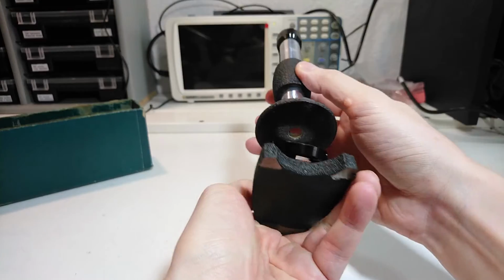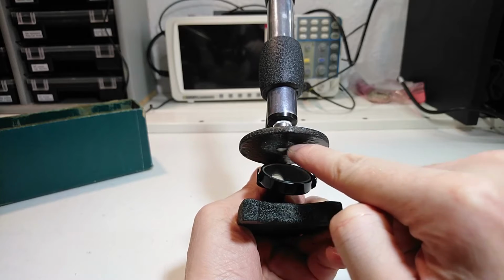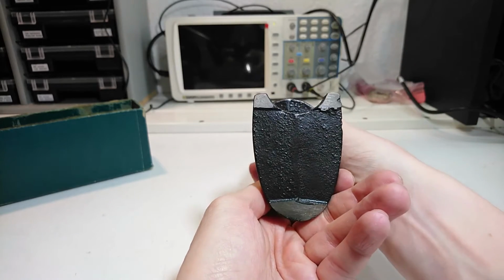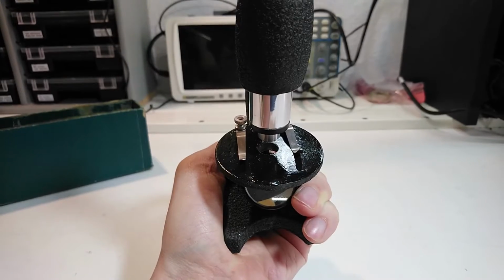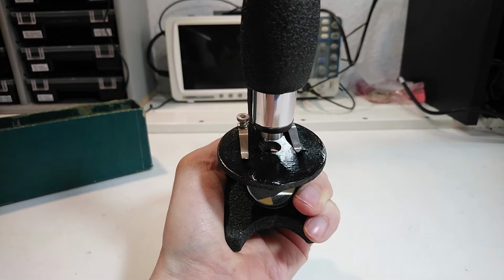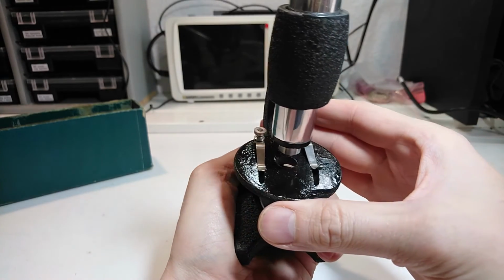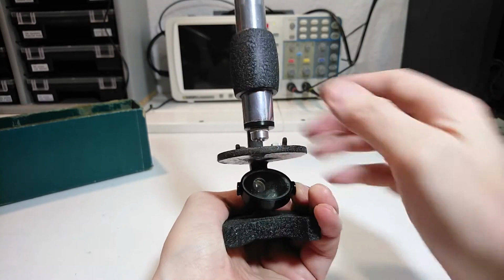The main body is made from cast iron, and I can still see the ridge created by the two halves of the sand casting. Only a few areas were machined after casting, the feet for example. The object table was not machined originally and looked as rough as the underside. I have already sanded the surface flat and repainted it black.